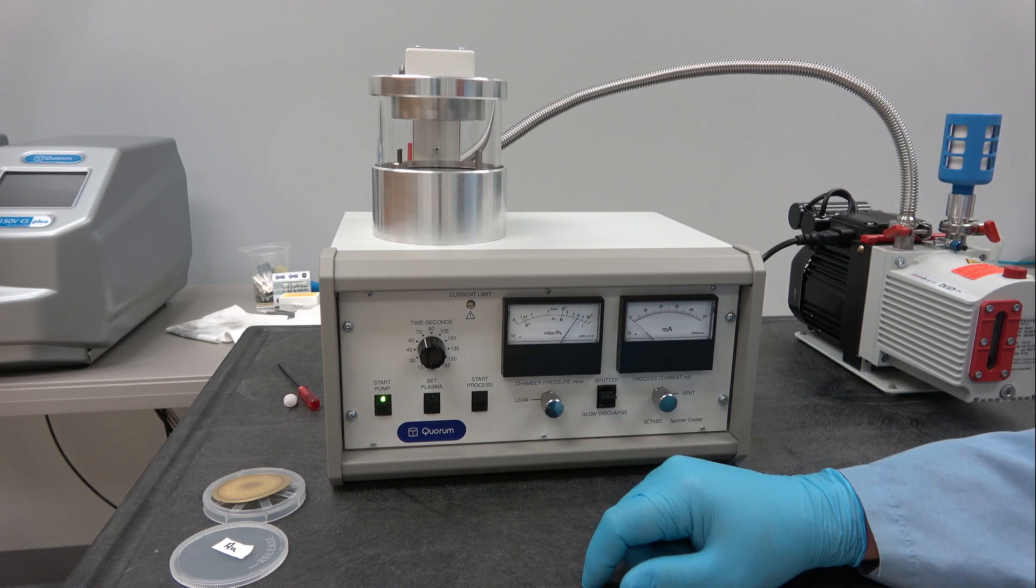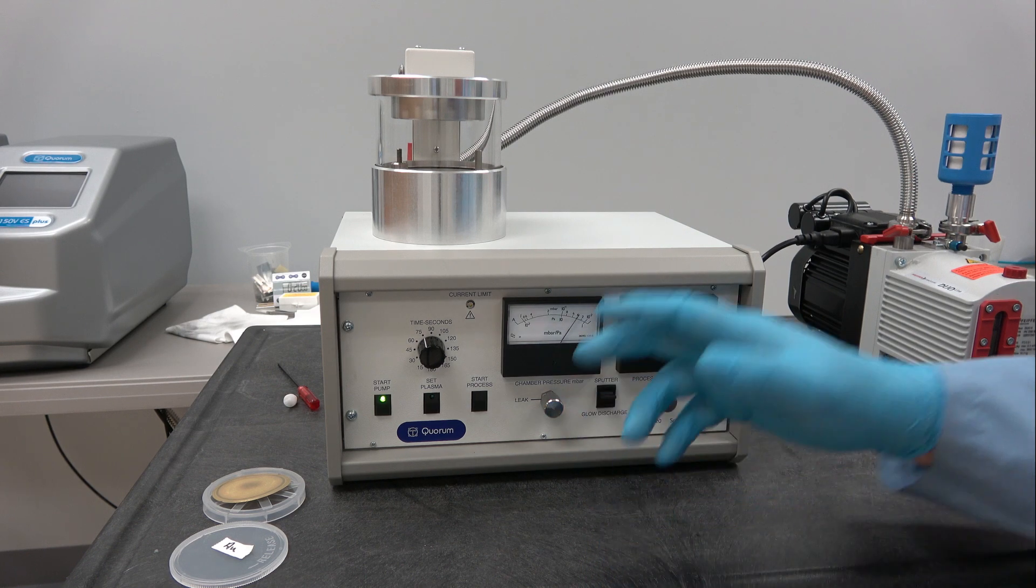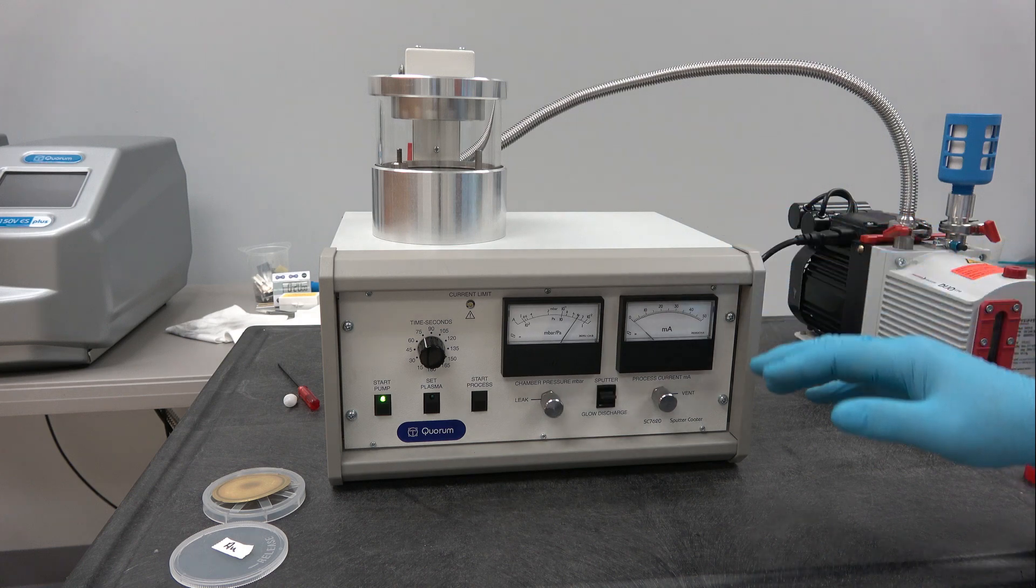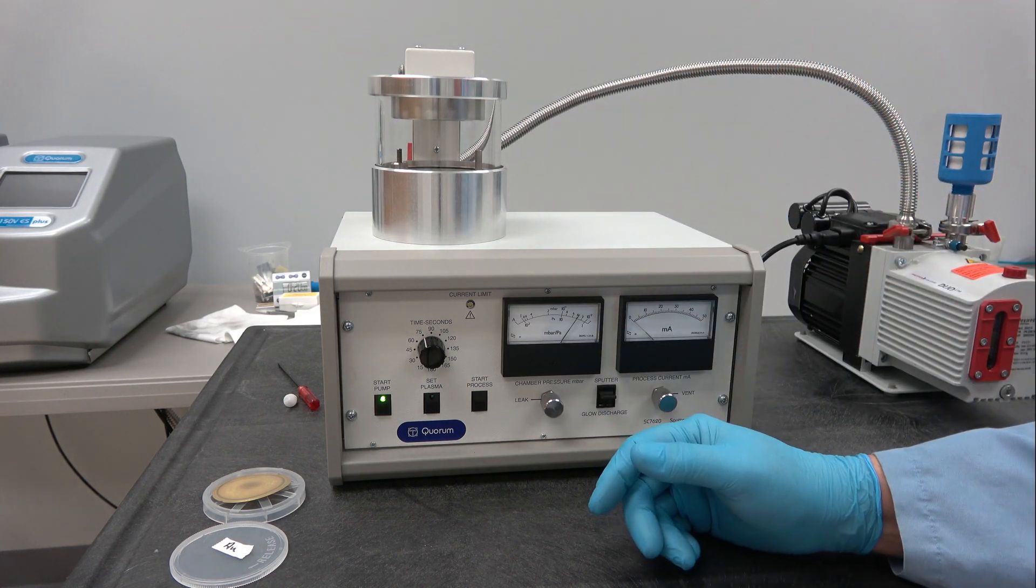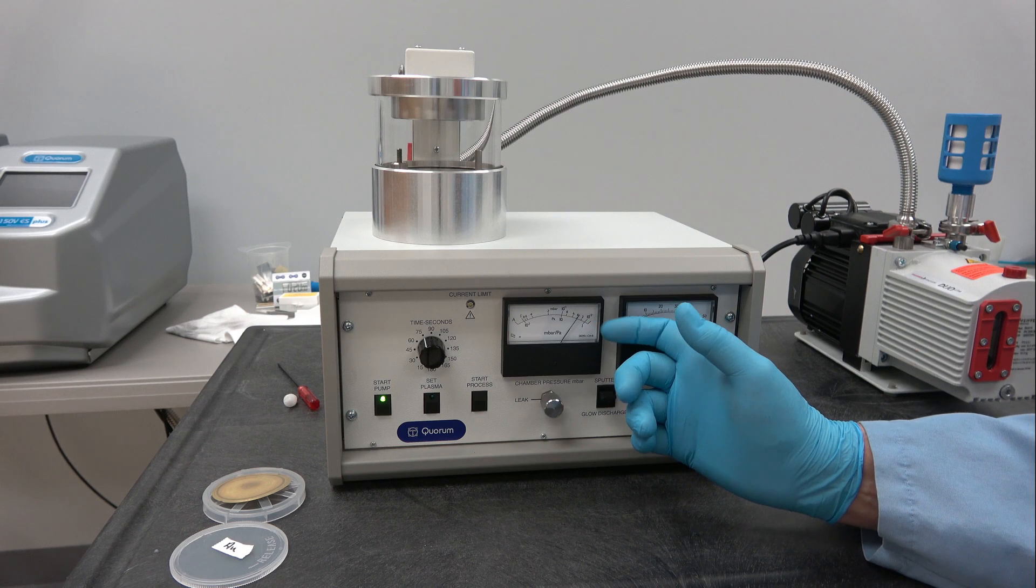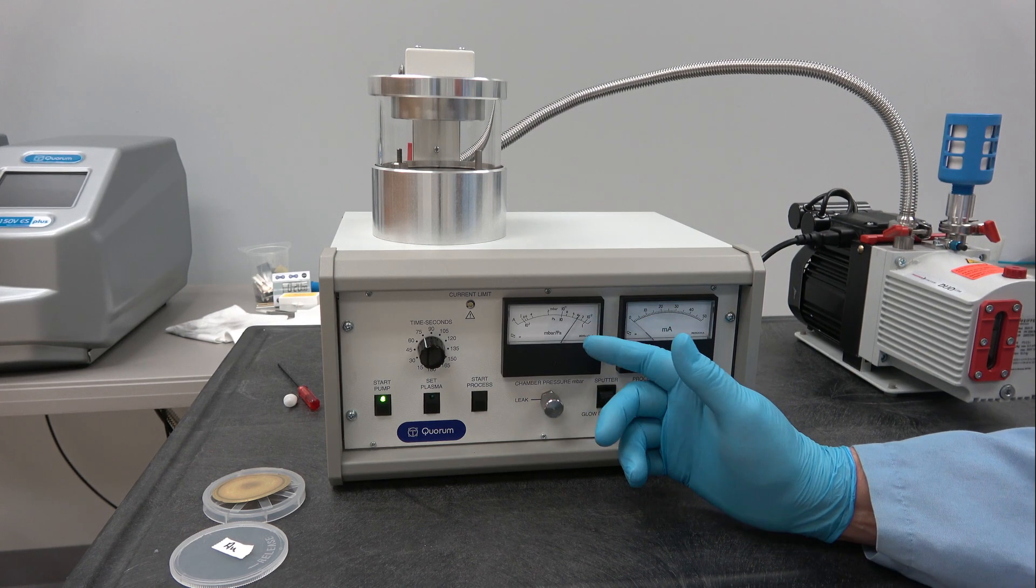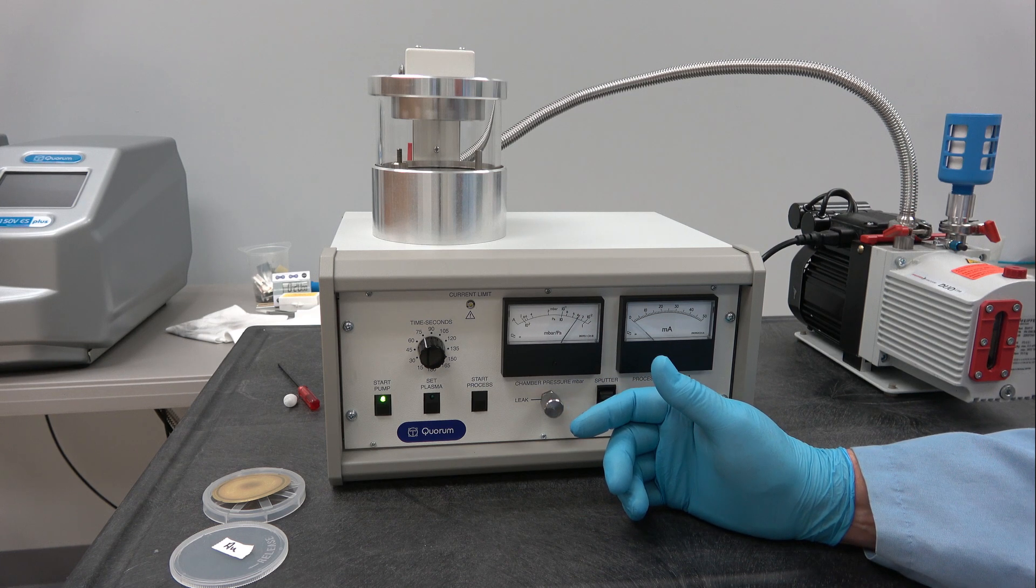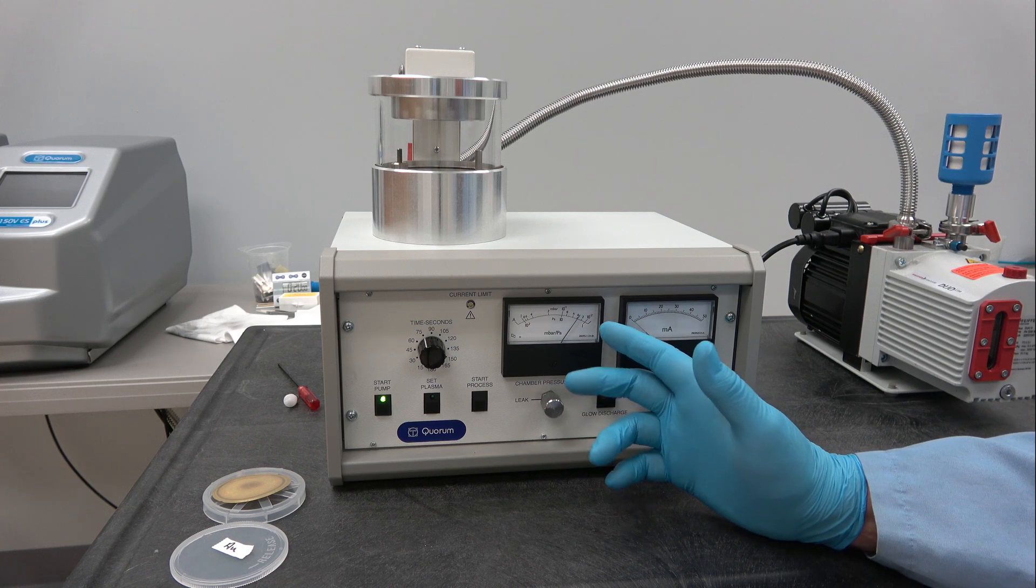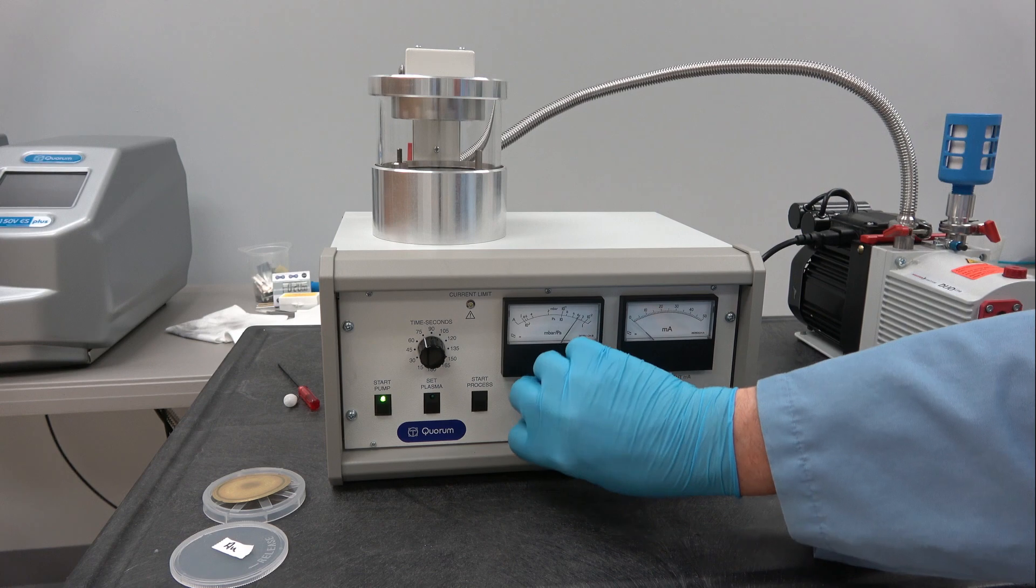You can see the vacuum has improved. Because we're working with a rotary pump system through a tube into a chamber, you really won't expect it to exceed the 10 to the minus 2 millibar range. But at any rate, this is a good enough vacuum to work with.